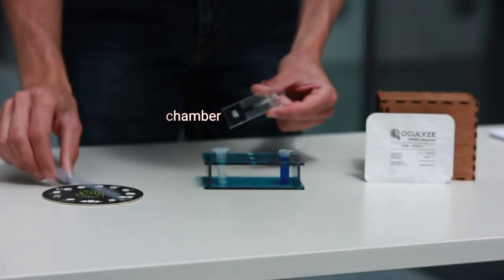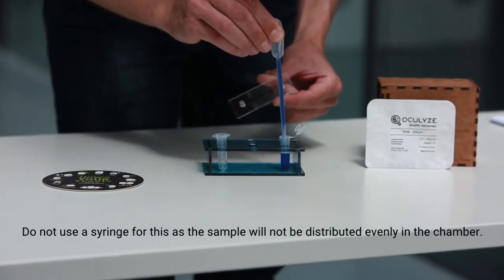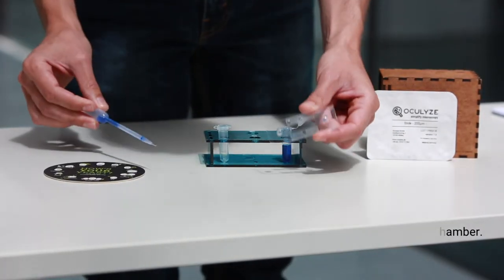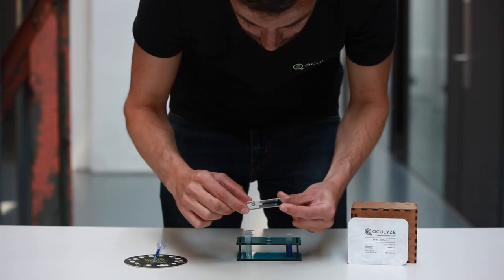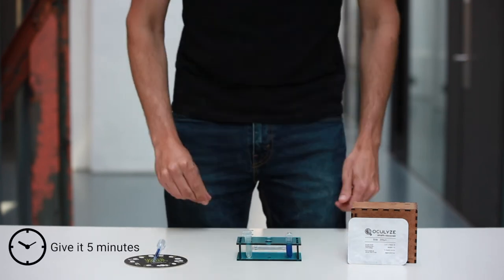Step 1. Use the Pasteur pipette to load a small sample. Step 2. Pipette this into either one of the chamber openings. Capillary forces will pull the sample through the chamber. Now, the chamber is ready.